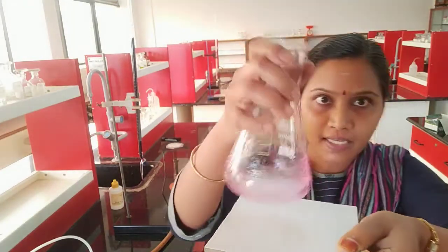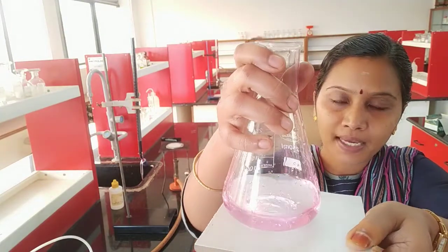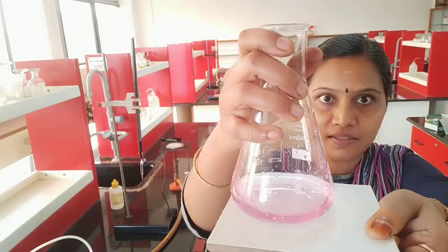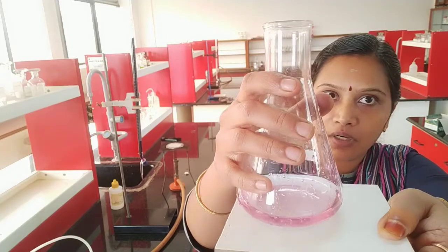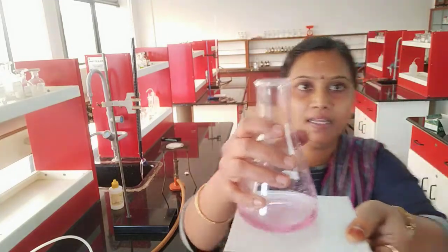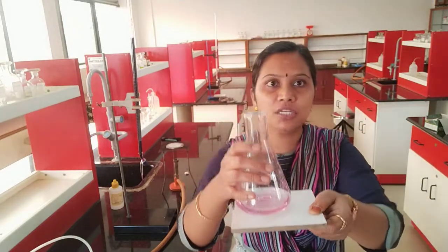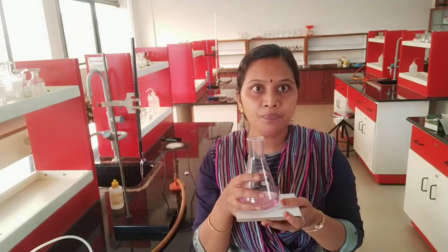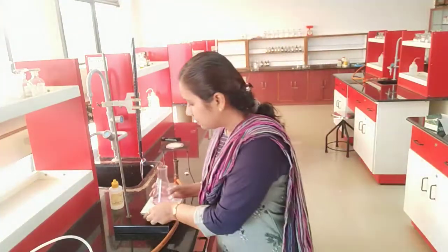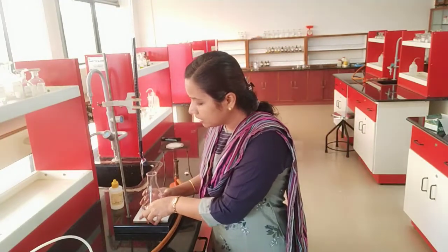You all could see the appearance of pale permanent pink color. I have noted my initial reading and the final reading. Final minus initial will give me the titre value.